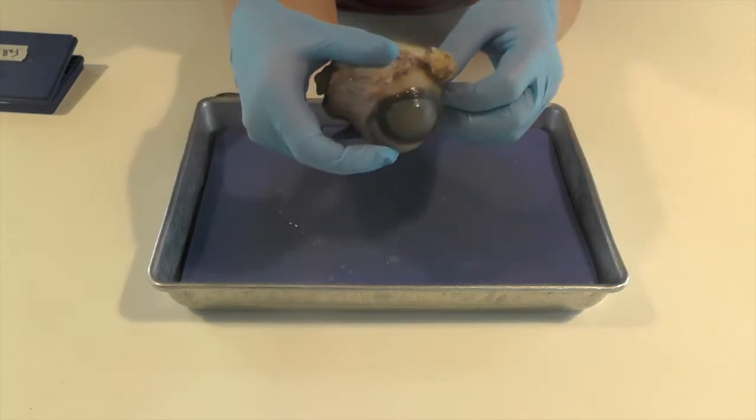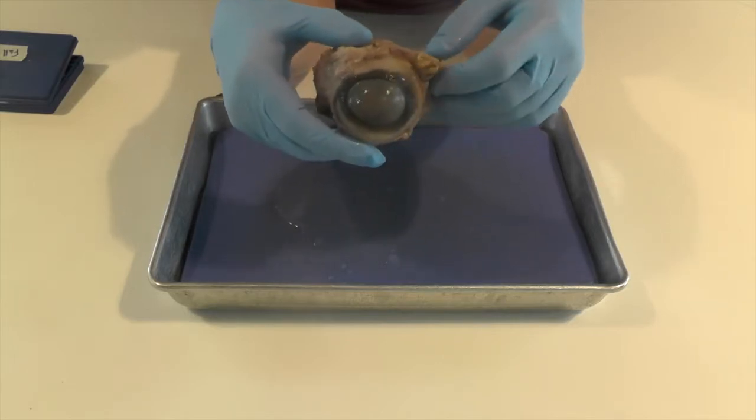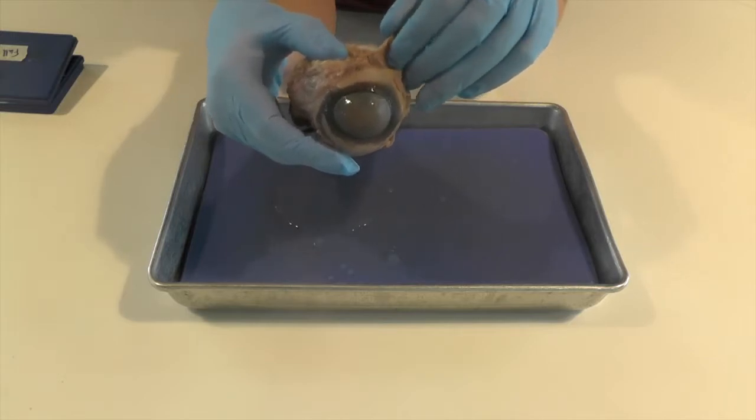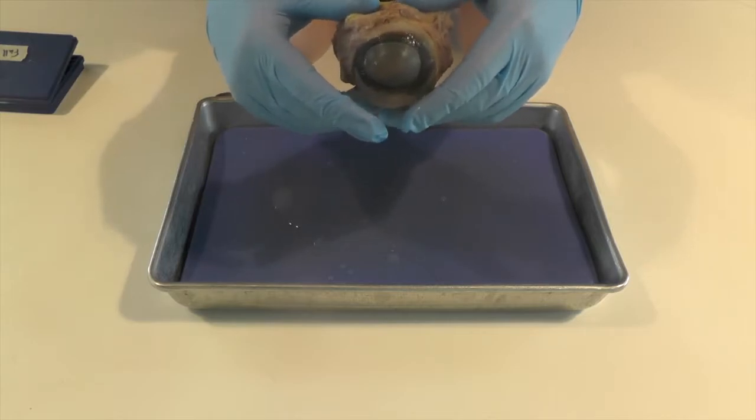They have one on the left side, the right side, and one that pulls up and down. So a cow's never going to roll its eyes at you. But humans have six muscles so we can have more of a diagonal motion that we are able to do.